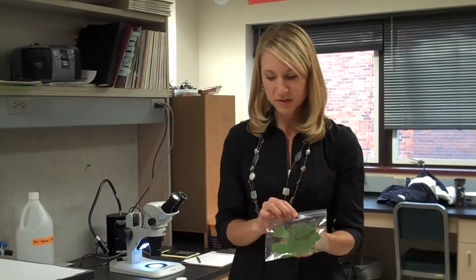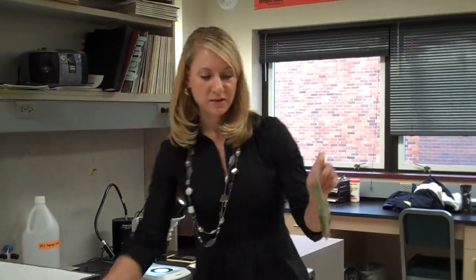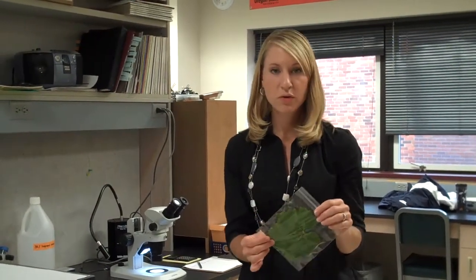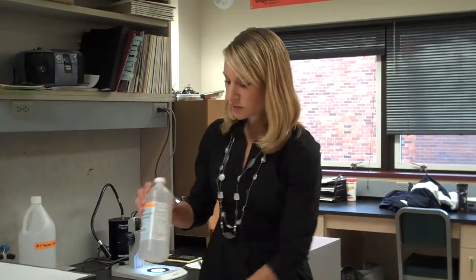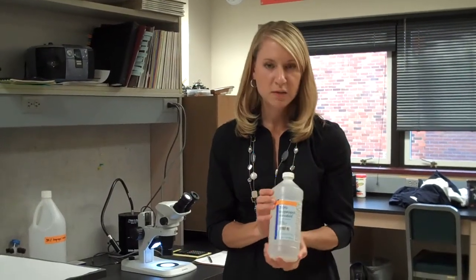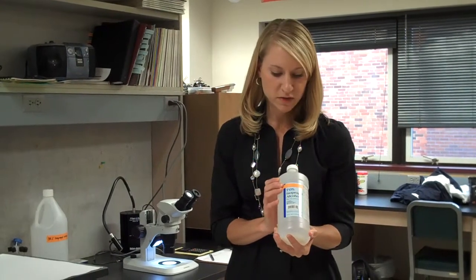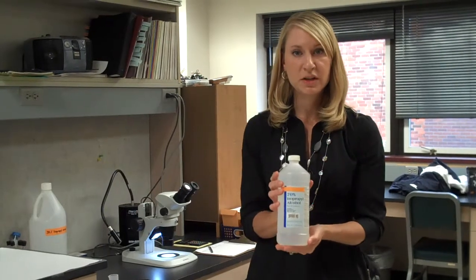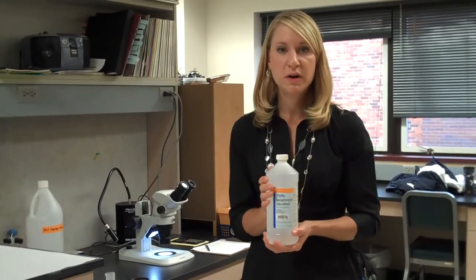This individual bagging is also helpful for our washing technique. For this technique you need ziplock plastic bags that are about sandwich size to fit a full leaf, or any other vine tissue sample you might want to use — early season shoots or little buds early in the season. You'll also need some rubbing alcohol, usually 70% isopropyl alcohol from any drugstore, which we will dilute to 35% by mixing one part rubbing alcohol with one part water.